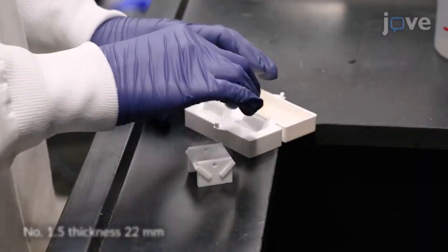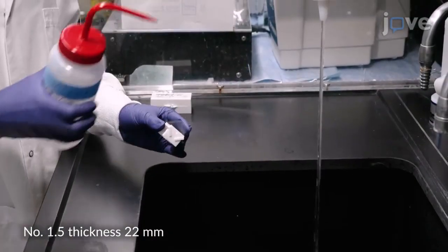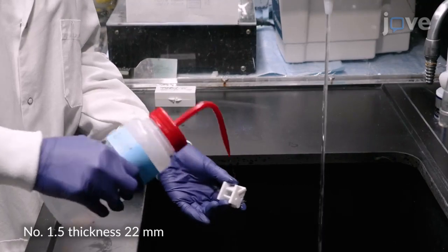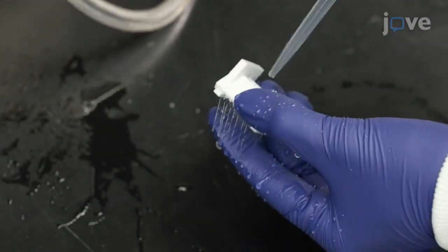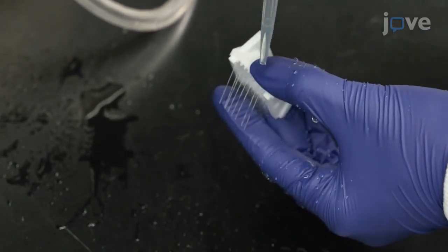Load 8 square cover slips onto a rack and thoroughly wash them with approximately 2 to 5 milliliters of 200 proof ethanol, followed by 2 to 5 milliliters of distilled water. Then dry the cover slips completely using a filtered air line or nitrogen line.